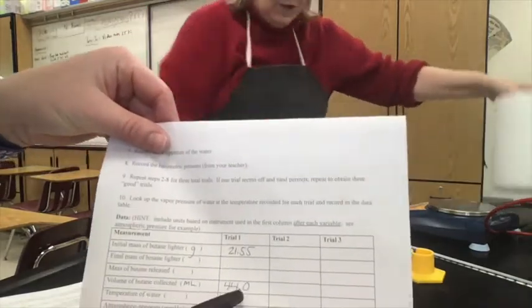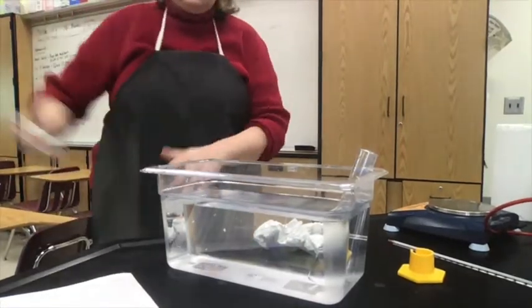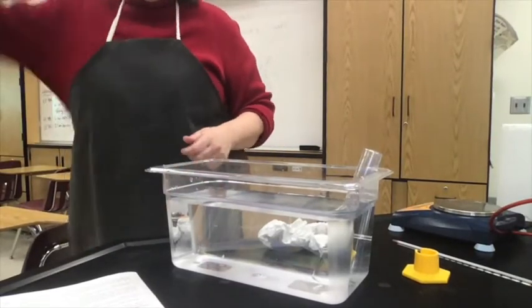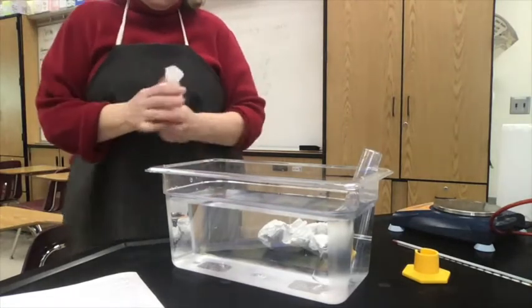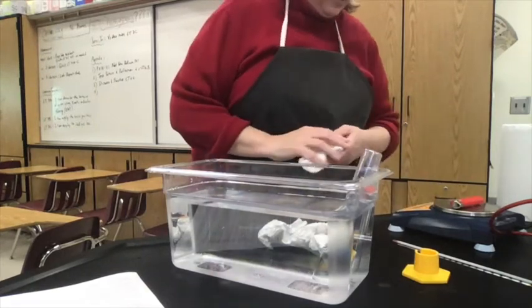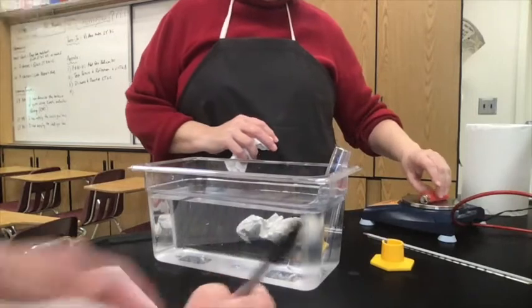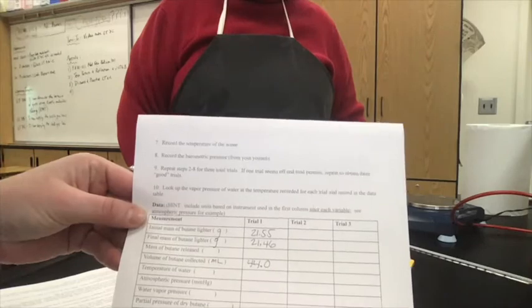And then now I'm going to go back up and do step 5. This is where, if we had more than one of us getting our hands wet, Ms. Franklin has to film. So I'm shaking it out again. Remember to shake the water out of that lighter and dry it really well. Don't want any water up in there. And zero my balance. And it has gone to 21.46. 21.46, again in grams.